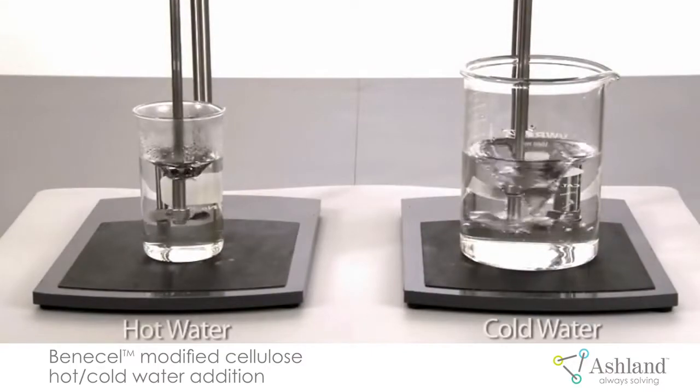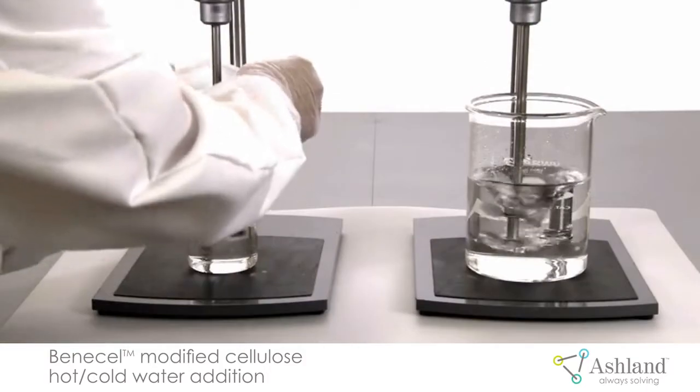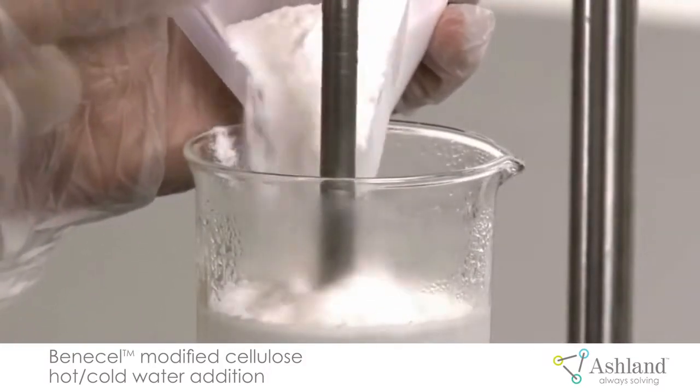On the left, we have hot water, and on the right, we have cold water. We will add the powder to the hot water and after it is dispersed, we will add it to the cold water where it will hydrate.